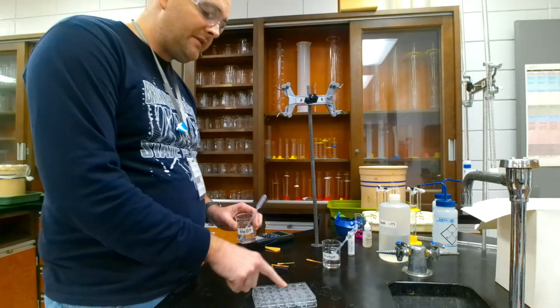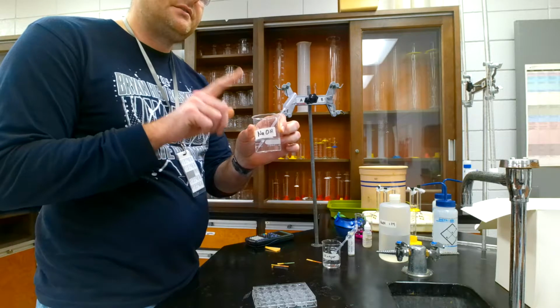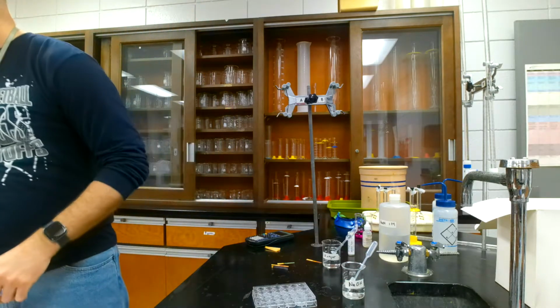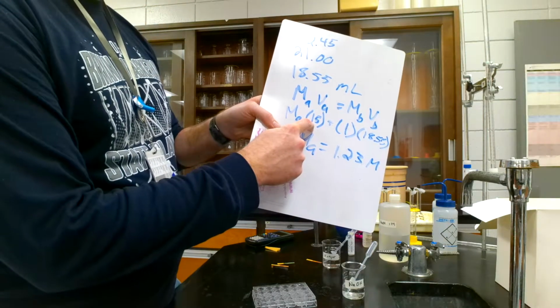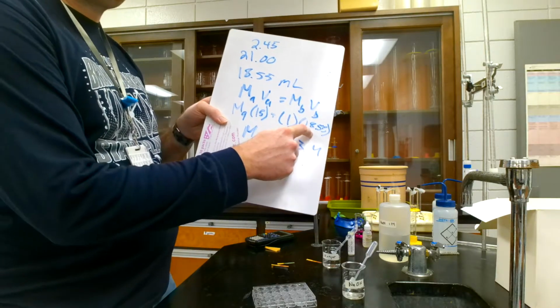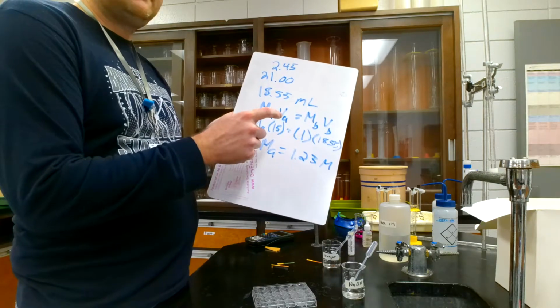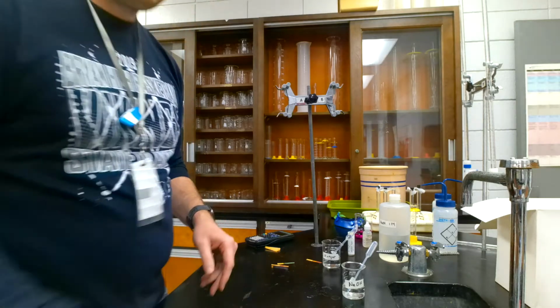Now remember, I put 15 drops of acid in there. I want to count how many drops it takes to neutralize 15 drops. Okay? So, just a little hint. It took us 15 milliliters of acid, and it took us 18 milliliters of base to neutralize 15 milliliters of acid. So I'm going to guess it's going to take about 18 drops to neutralize 15 drops of acid.